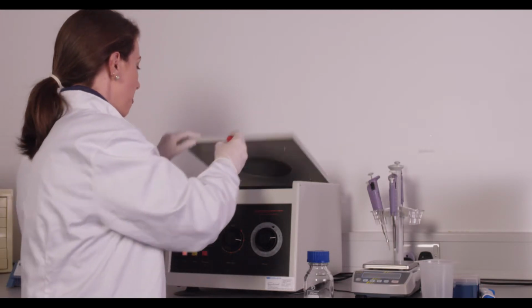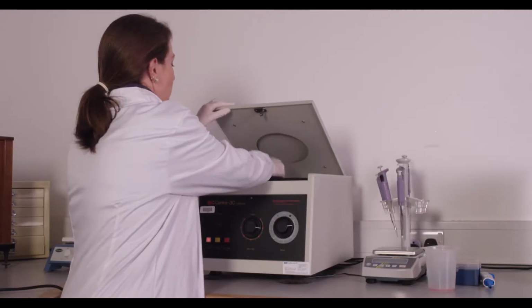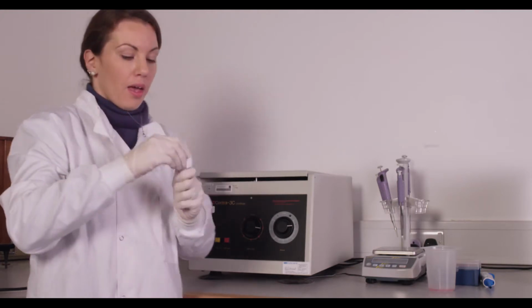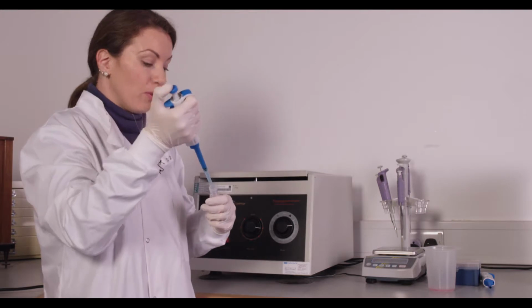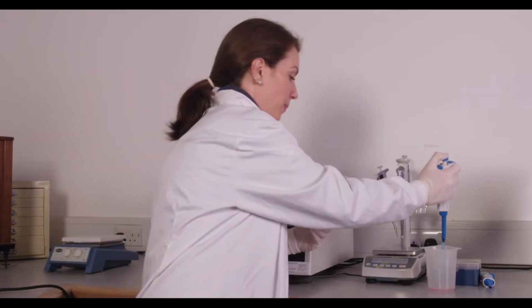You can take 10 microliters of this cell suspension and do a cell count while you're doing your second wash. Your second wash will again be the same centrifuge settings as what you use for your passaging of your cell type. Once your second wash is done, you'll take your cells and again remove the supernatant, being careful to remove as much supernatant as possible while not disrupting your cell pellet.